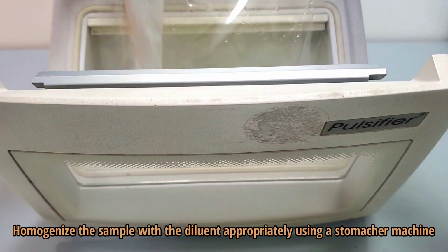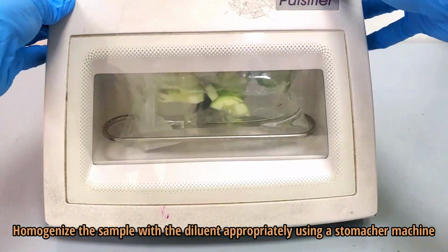Homogenize the sample with the diluent or normal saline appropriately using a stomacher machine.